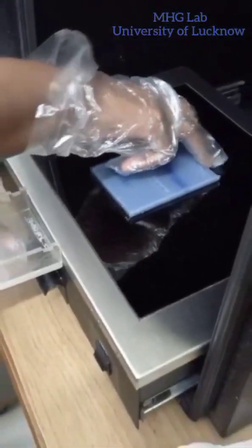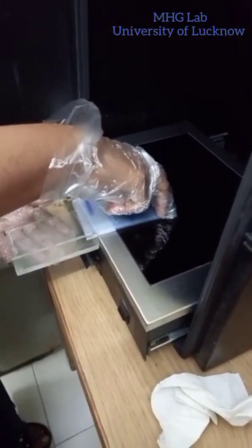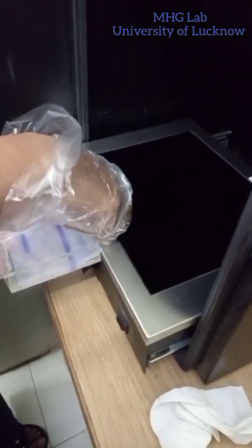As we have visualized the gel, we will now remove it. And this is how we remove our gel.